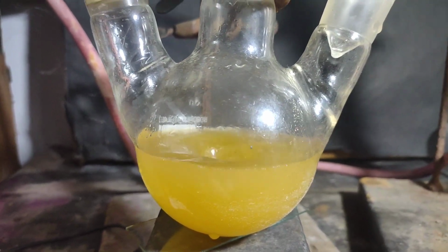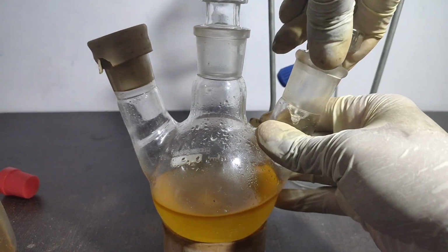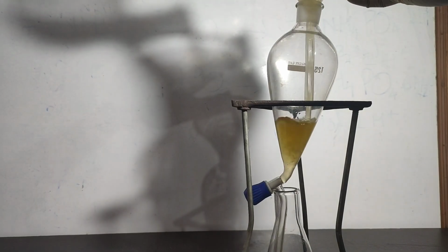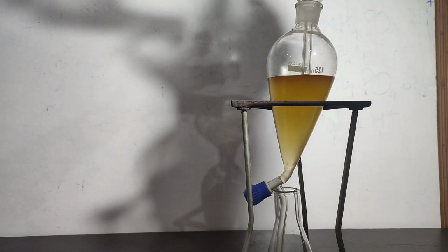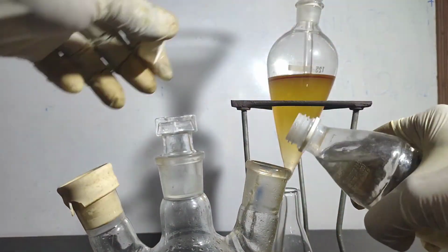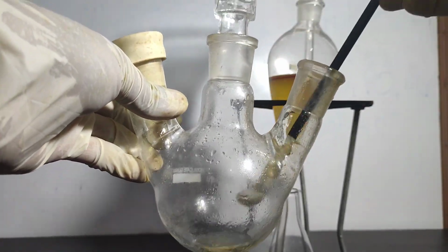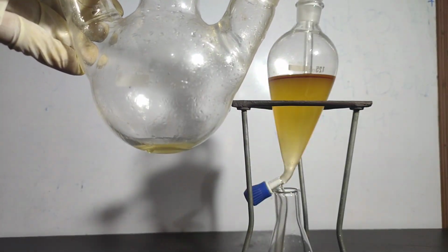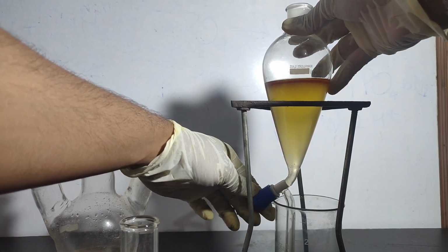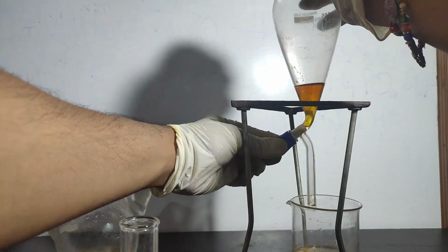I then stoppered the flask and stirred it for a minute or so. When stirring was stopped, the petroleum ether layer turned brown. It was transferred to a separatory funnel. The flask was washed with a small amount of petroleum ether. The stir bar was taken out with a bead picker and the petroleum ether was transferred to the separatory funnel. The lower aqueous layer was drained off in a beaker, but accidentally some ether layer also went in it.